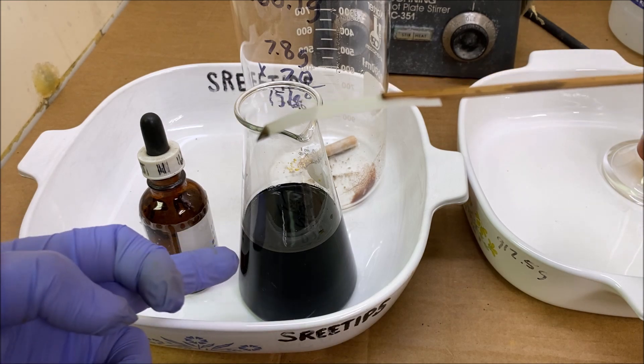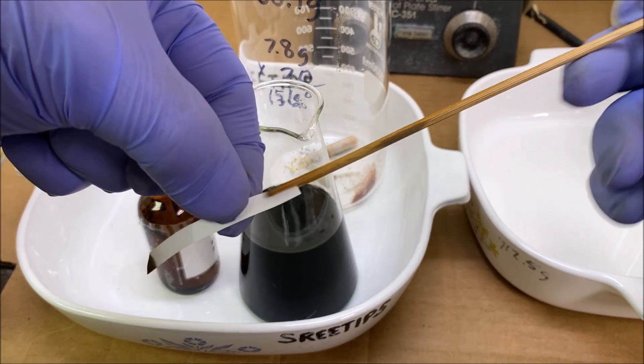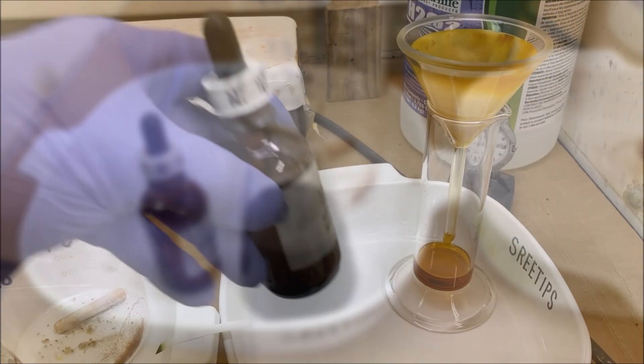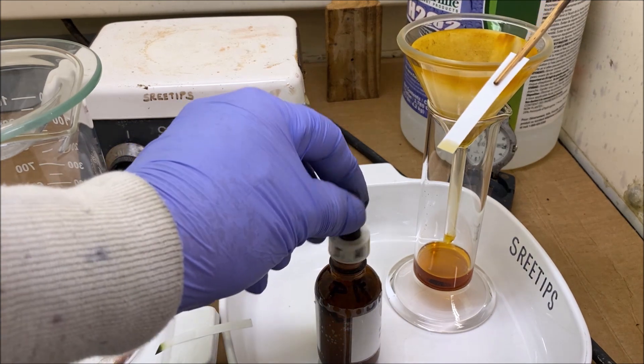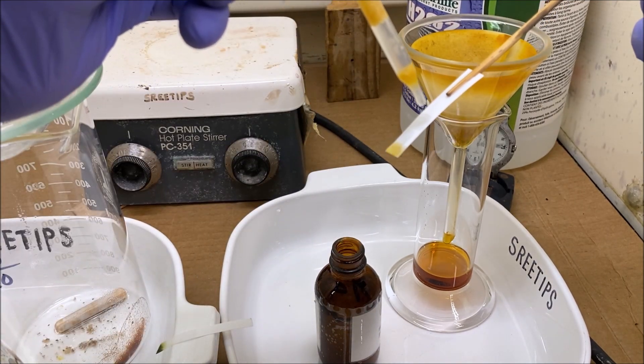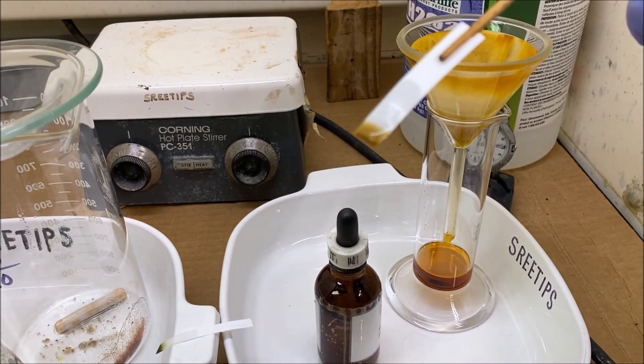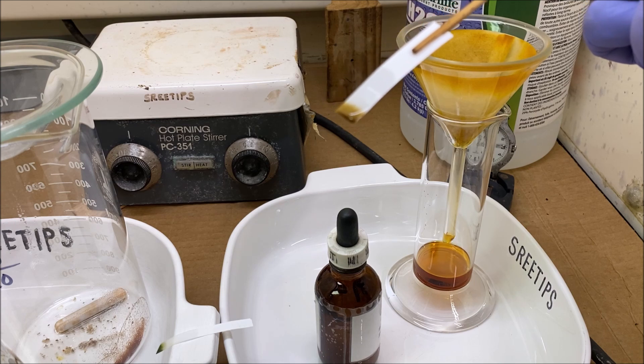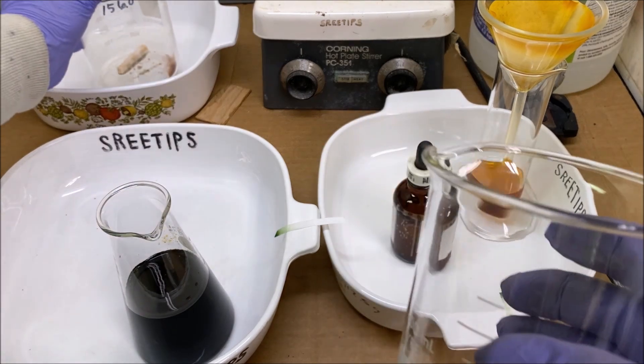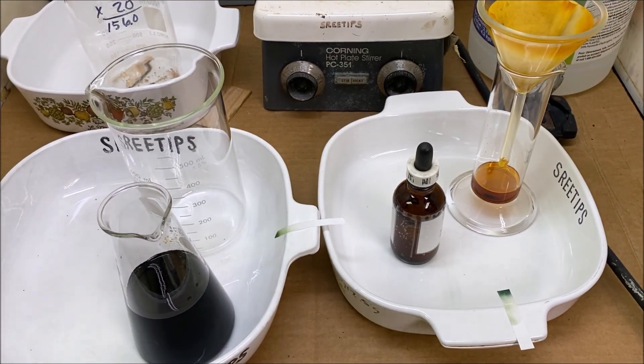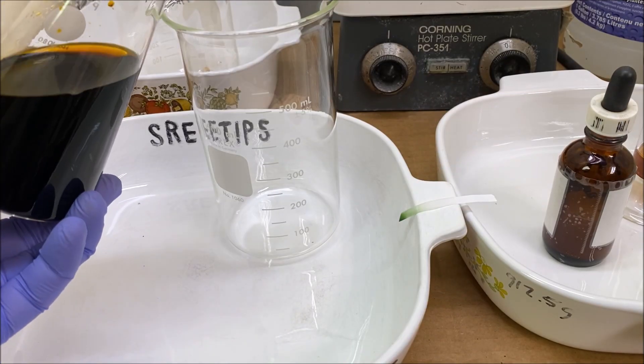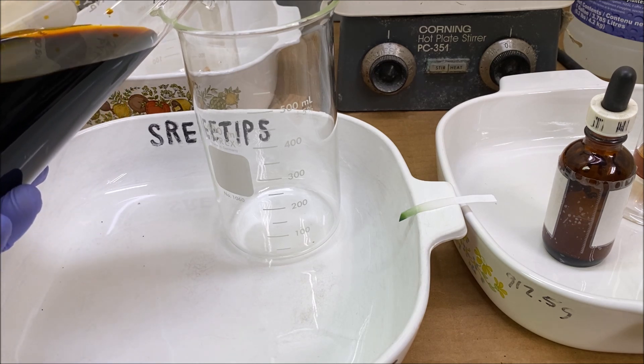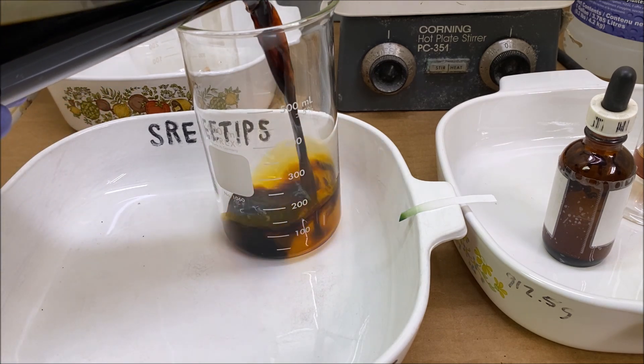Which tells me that there's platinum and palladium in here. Just to show you what this solution has in it, get a little of this on a piece of filter paper. It's not quite as dark as you can see, but it does have some precious metals in it. What we'll do now is transfer our main solution into a small clean beaker, and I'm shooting for about 150 milliliters of solution here to get the correct concentration.